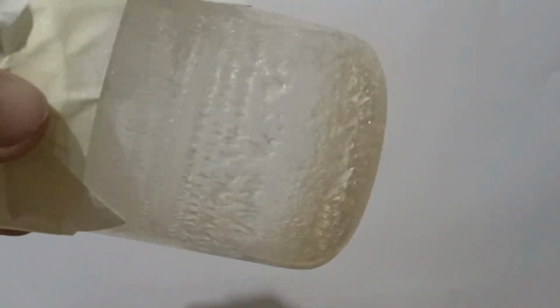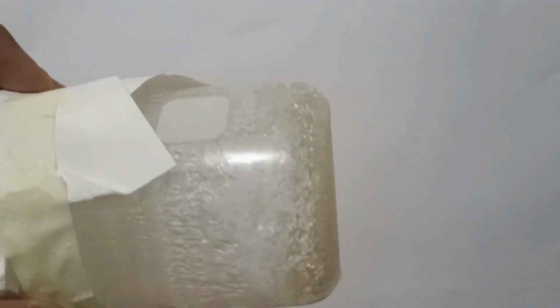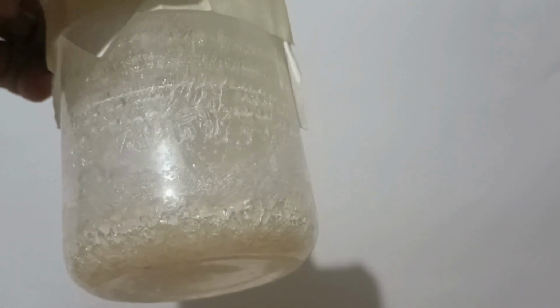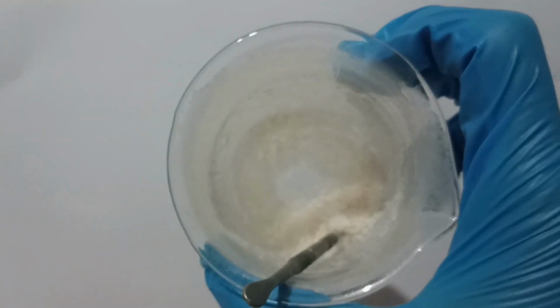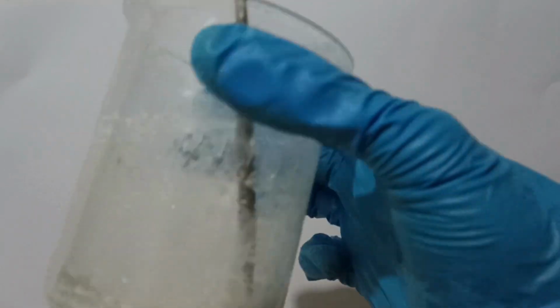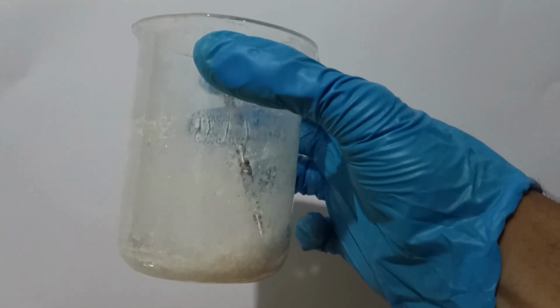After a week, all the methanol had evaporated, and I got these slightly pink crystals. I started chopping them in order to determine the yield. I started placing the crystals on a scale and basically scratched the beaker for several minutes.